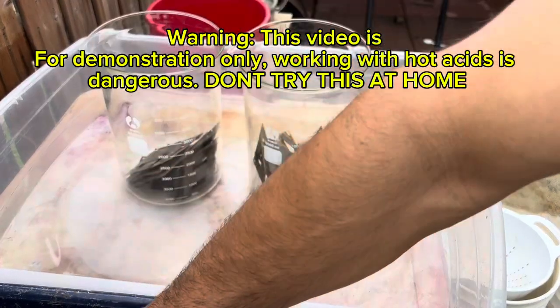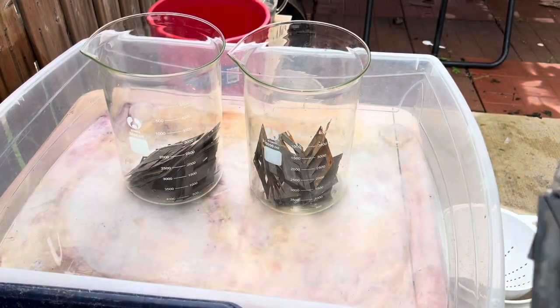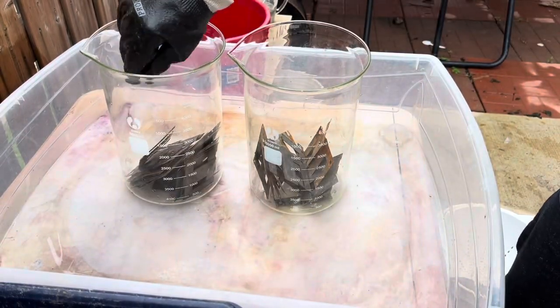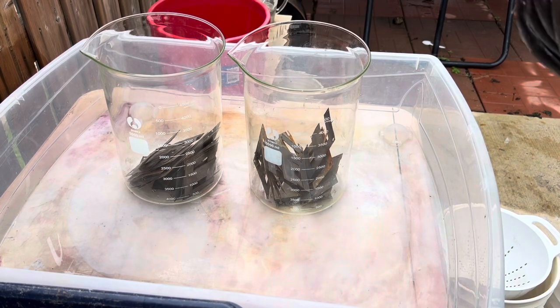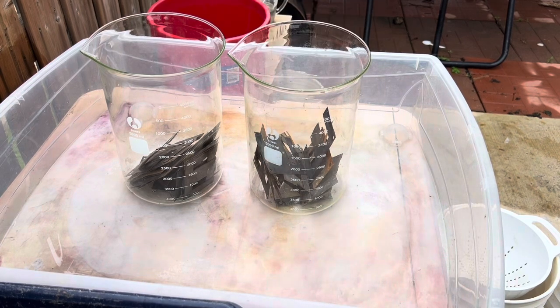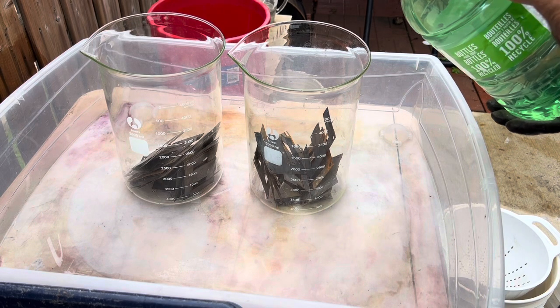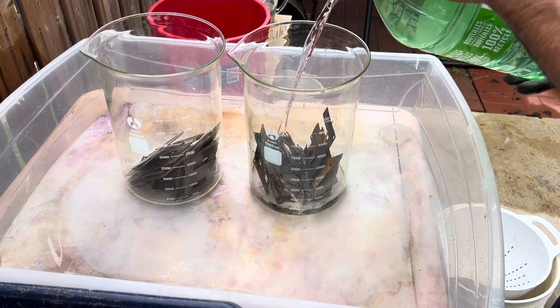Today I'm going to try to make my own copperas, just because I suspect the ones on Amazon aren't pure — they're not intended for lab use. I'm going to make my own for precipitating gold. It's very good to work with copperas, or iron sulfate.